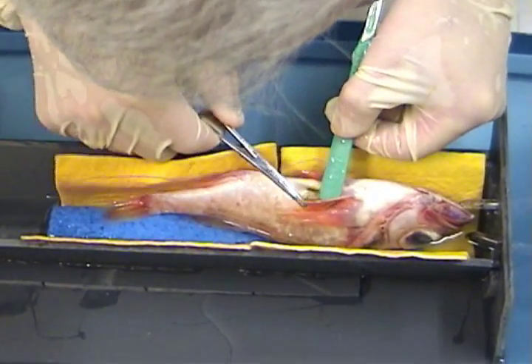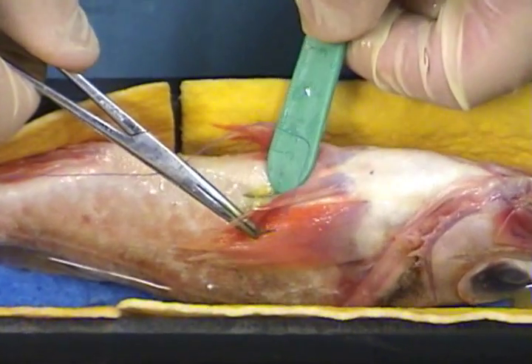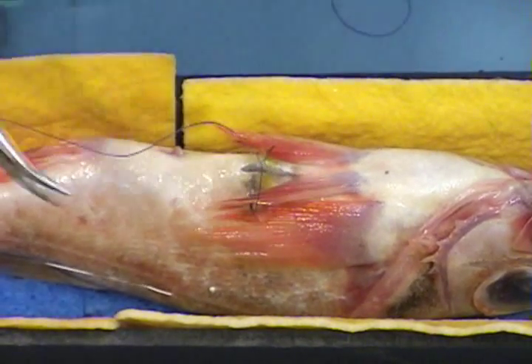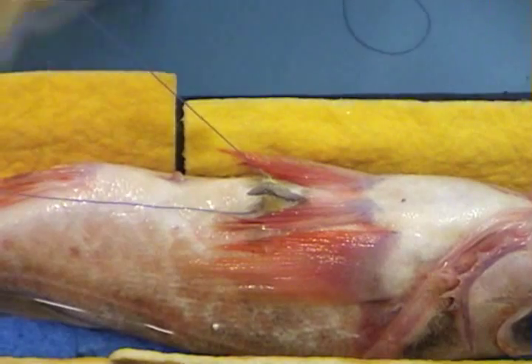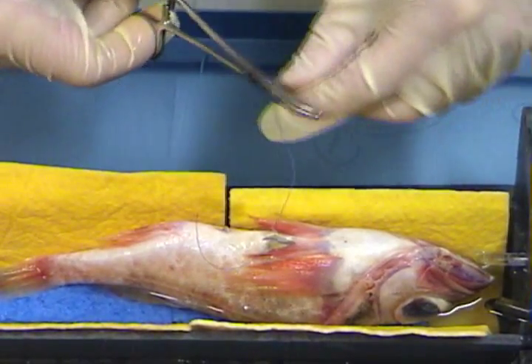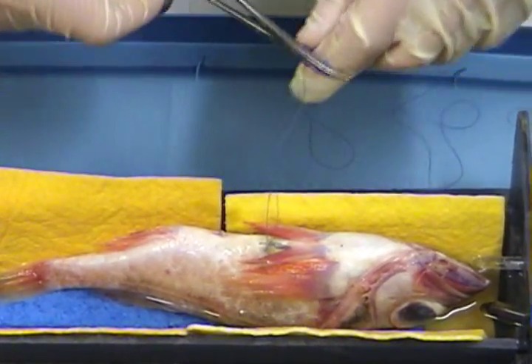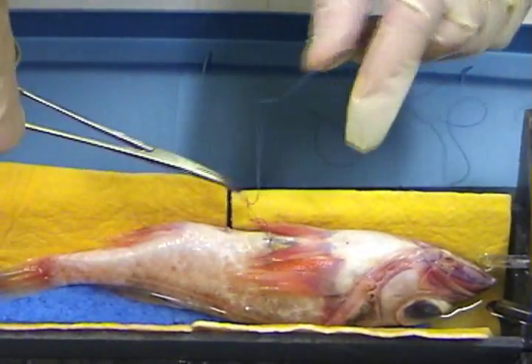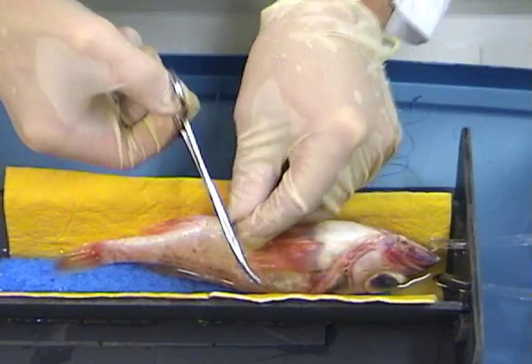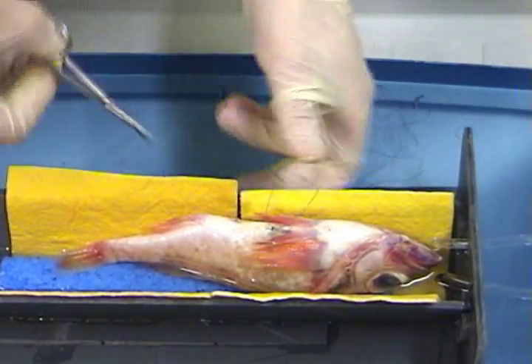The final step is to close the incision. To do that, I first place the blunt end of the sterilized scalpel just inside the incision to allow me to puncture the needle through the skin and subdermal layers. Once through, then I go through the other side from inside to outside and pull the suture through until you are left with approximately 4-5 cm of suture. To make the closing knot, wrap suture around the end of the needle drivers in a clockwise direction for two turns. Then grab the suture ends and pull with the needle driver hand towards you and your other hand away from you to form the knot. Use the same procedure to form the second knot, but this time pull your hands in the opposite direction and pull tight to form the knot. I like to repeat this step one more time with the third knot to prevent the second knot from coming undone. Snip the suture approximately 5mm from the knot and now you are ready to do the second closing stitch.